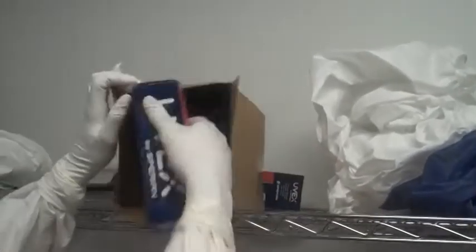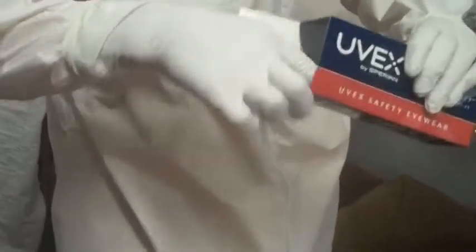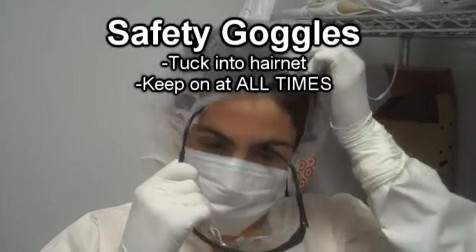Lastly, we have to put on our safety goggles. The last thing we want to do is expose our eyes to some of the dangerous chemicals used inside the cleanroom. Grab a pair out of the box and open them up out of the plastic wrapping. When you put them on, make sure you tuck them into your hairnet.